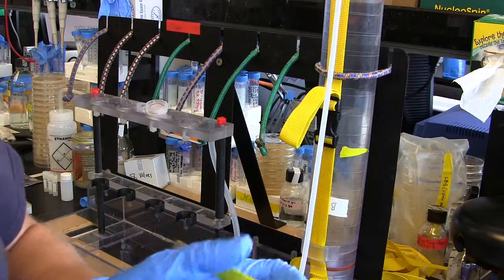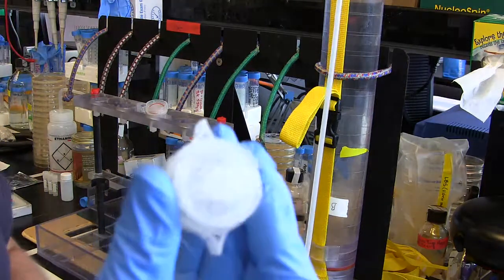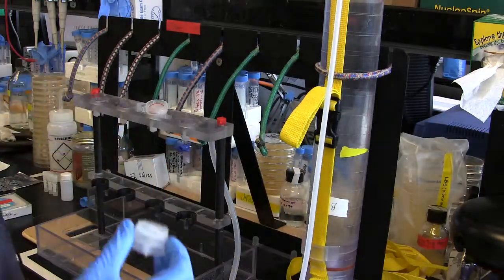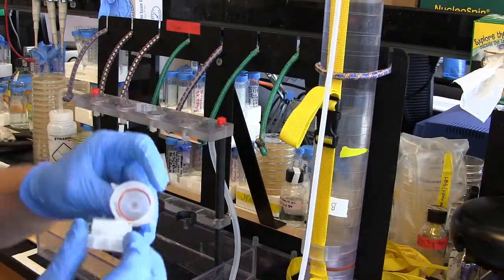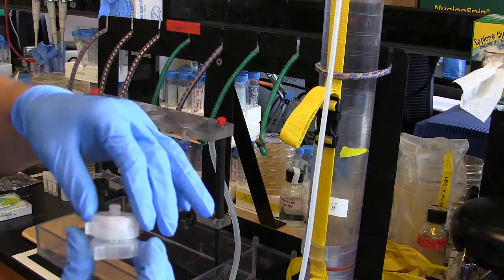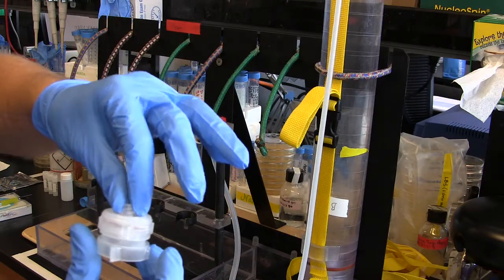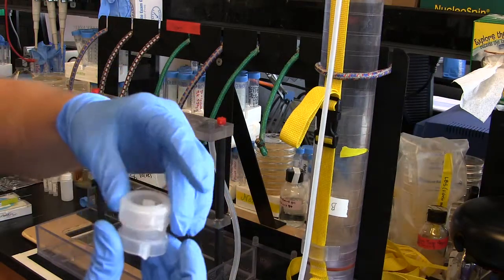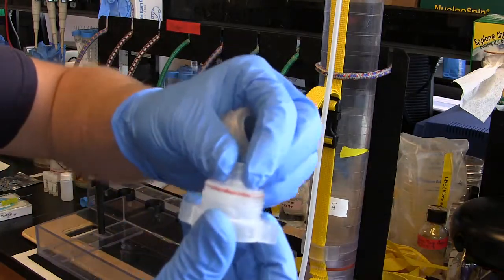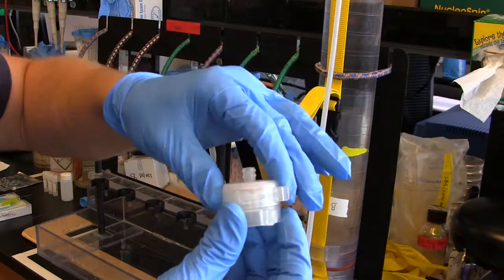I'll double check that my filter is actually seated nicely in the center of the filter holder, then lay the top back on like this. Back off the ring and slide the little teeth into the crenellations on the side, then tighten it up — just snug it.